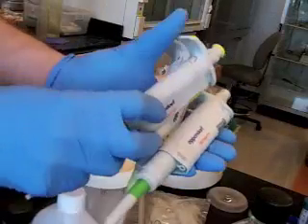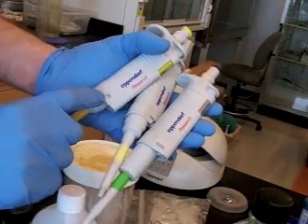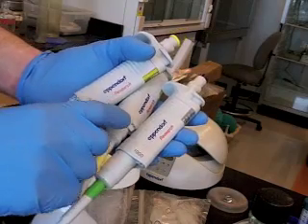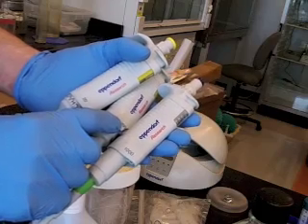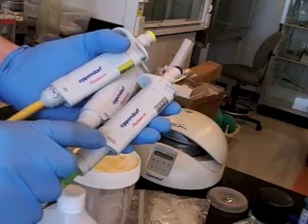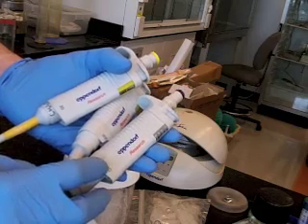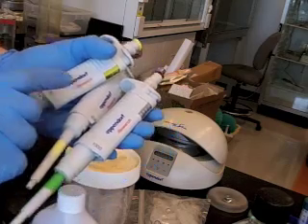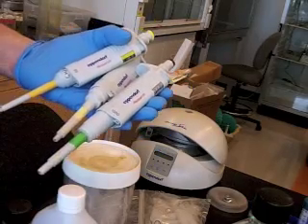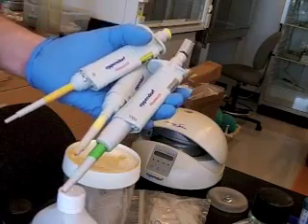This is a pretty classic range of 3 micropipettors: one that is great at measuring volumes up to 20 microliters, then one from 20 microliters up to 200, and then one from 200 up to 1,000. The idea is that this one is not as accurate under 200 as this one, and so forth. So you always want to try to pick a micropipetter that's appropriate for the size. There are other sizes. Here's one for really small volumes, but those are the classic 3.